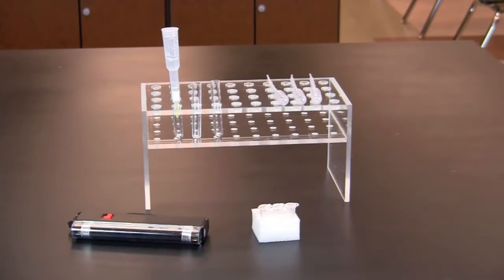In this video, you will learn how to perform hydrophobic interaction chromatography, or HIC.